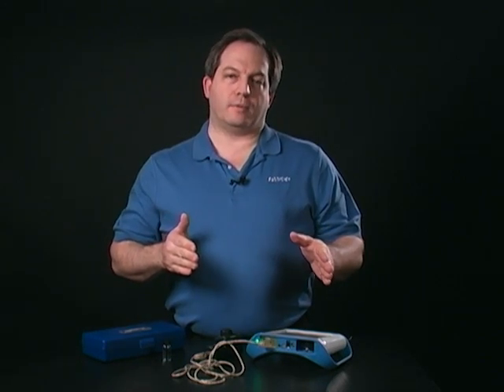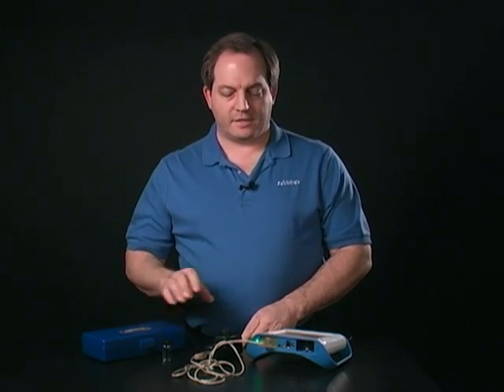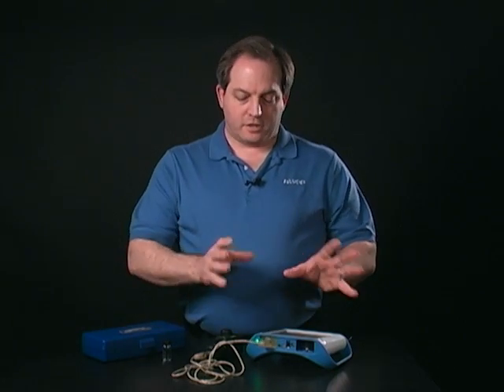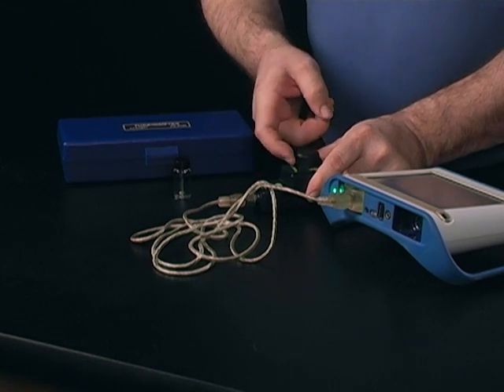It's going to take a few seconds more to get that second reading. The turbidity sensor is measuring scattered light — it's sending white light into the sample and looking at the light that is scattered by the sample, which is the nephelometric system. Therefore, the nephelometric unit, or NTU, is what we're measuring. This is a 100 NTU sample that comes with the device. Once it's done calibrating, we should see approximately 100 NTU on the screen, which we do.